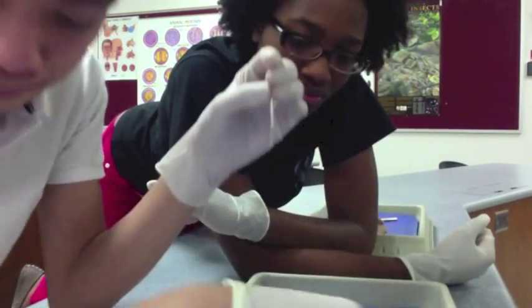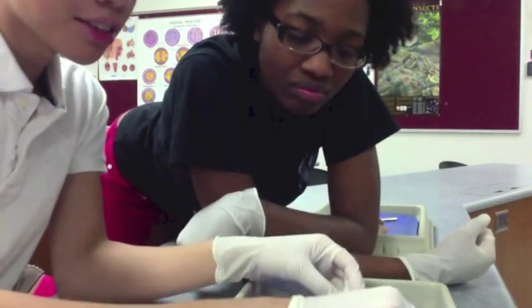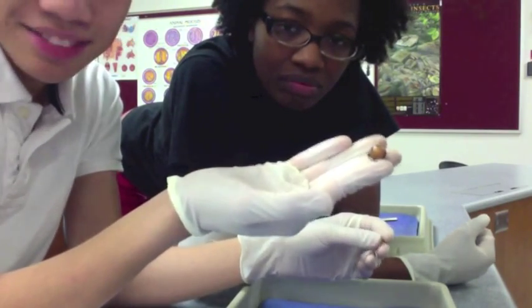You have your lens, which is this thing right here. This is your lens.